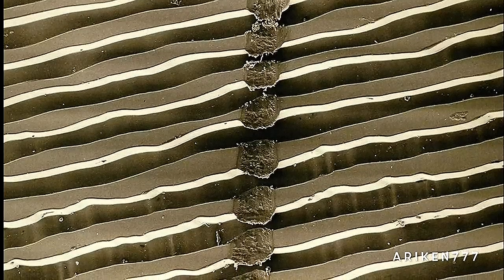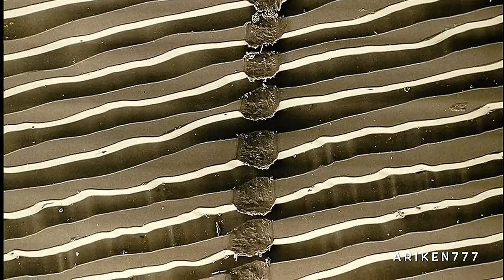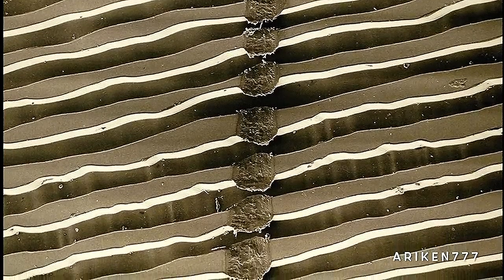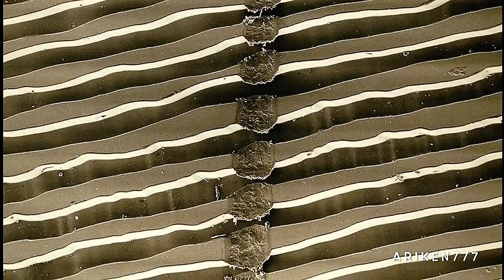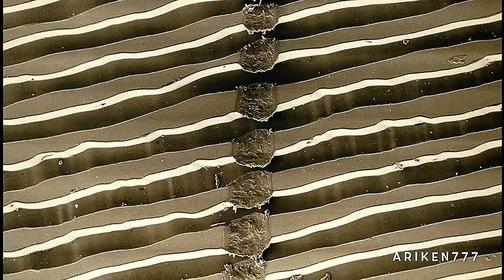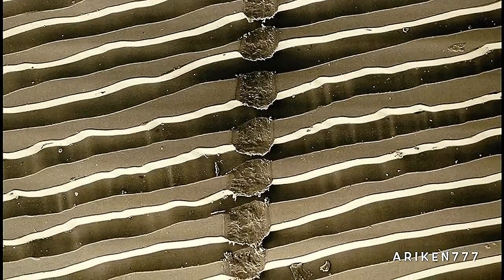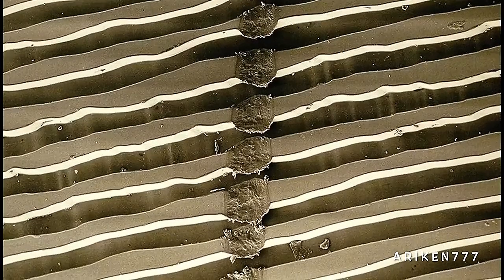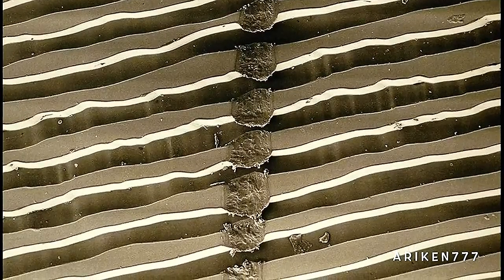The surface of a long playing stereo record with a scratch across the grooves. The grooves are cut into a flat disc of polyvinyl chloride. The nature of the groove varies with the intensity of the music. The straighter the groove, the quieter the music. The more wavy the groove as seen here, the louder the music.